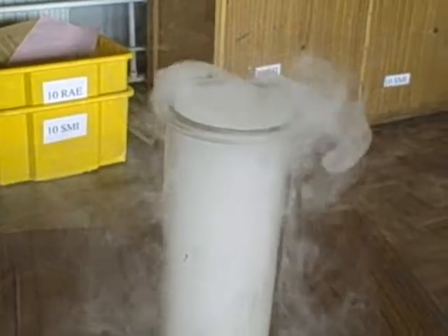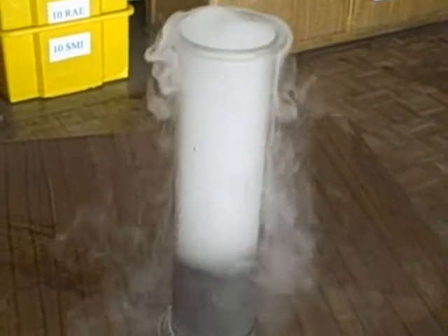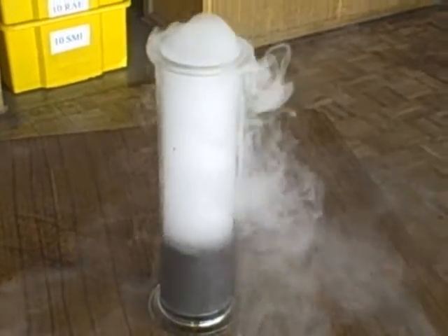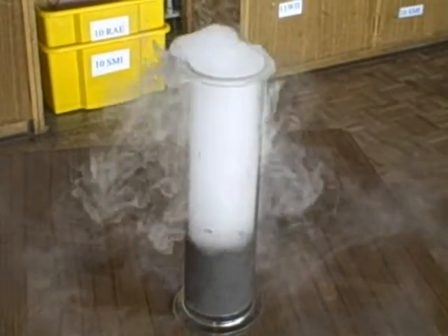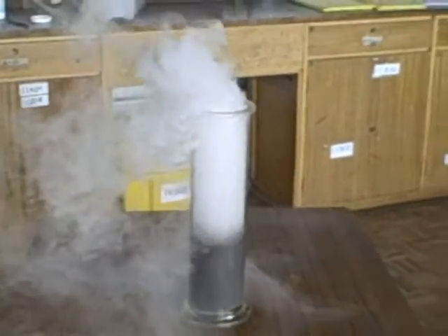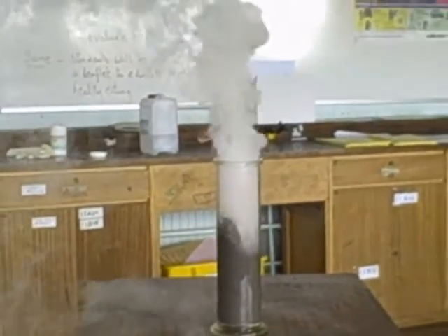Here's the same reaction again. This time, a little bit extra catalyst has been added, and some more hydrogen peroxide. You get an idea of how vigorous this reaction can be. Notice how the reaction speeds up. This is because, being an exothermic reaction, the heat produced also causes the reaction to get more vigorous.